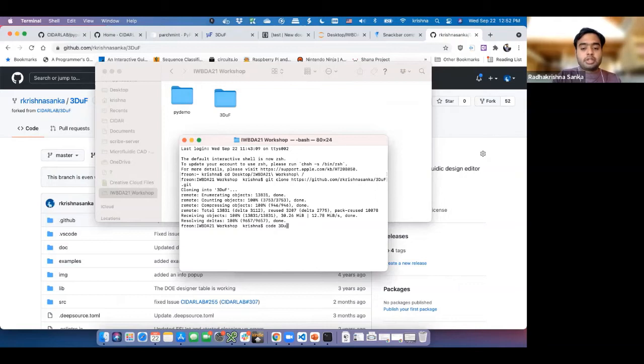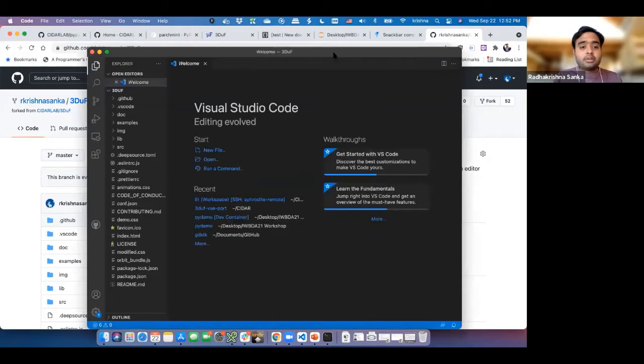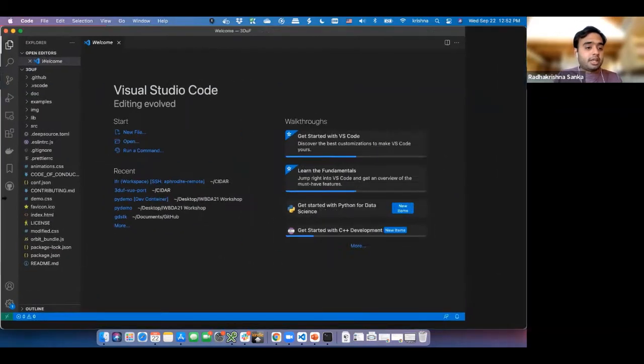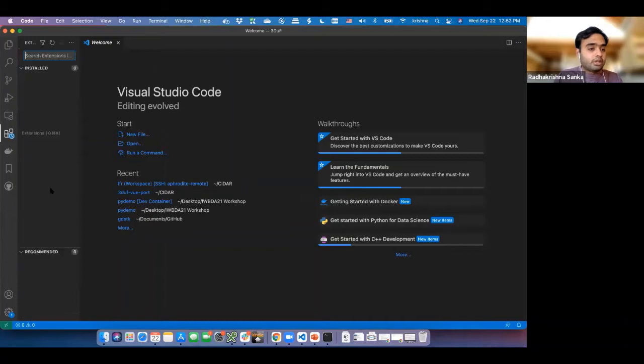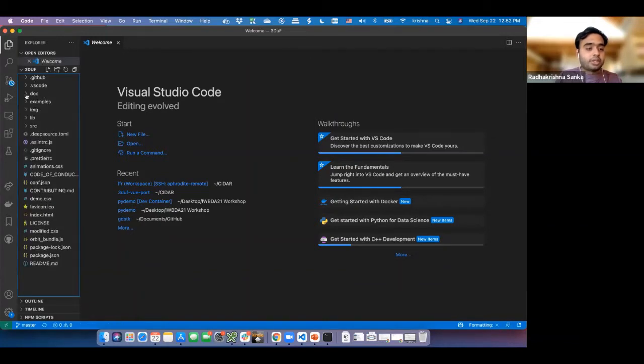So we recommend using Visual Studio Code as your default IDE, because we picked out a lot of recommended plugins for this entire project, and that's the easiest way for you to work. If you look at the recommended things over here, everything from Markdown to all the other stuff will be popping up for you as soon as you open it. We set up a lot of things so that it's easy for you to work in Visual Studio Code.